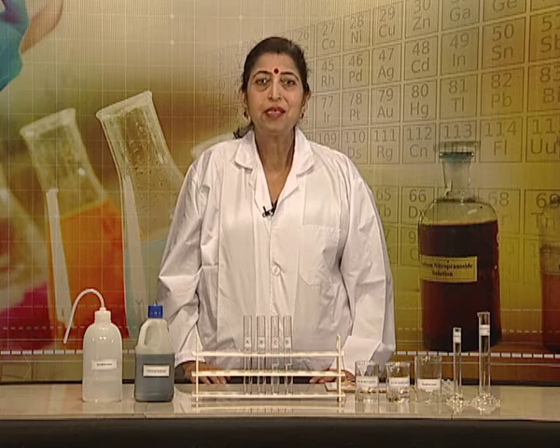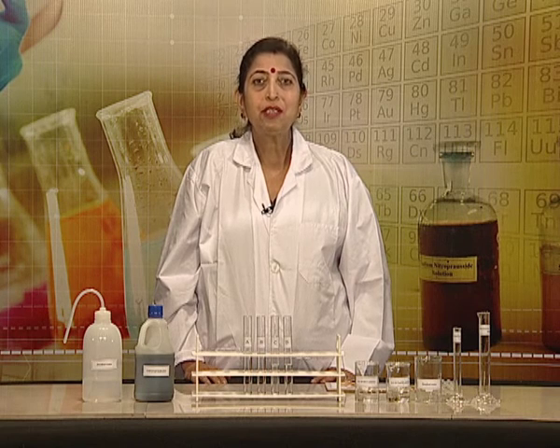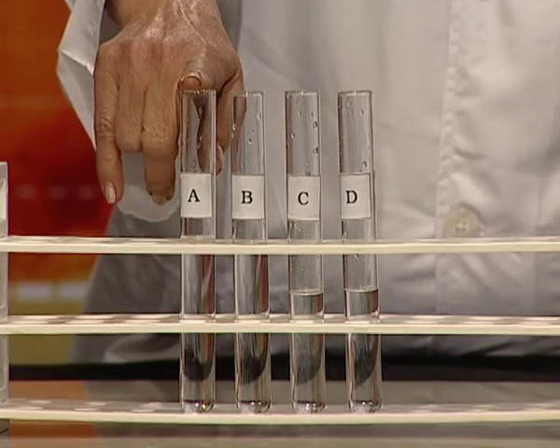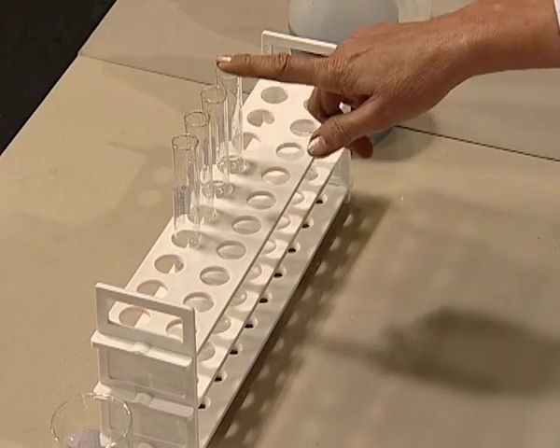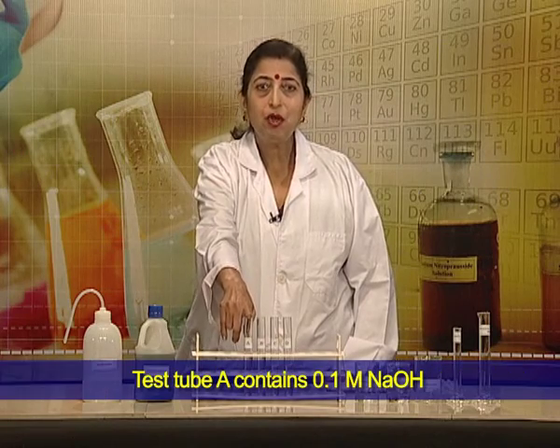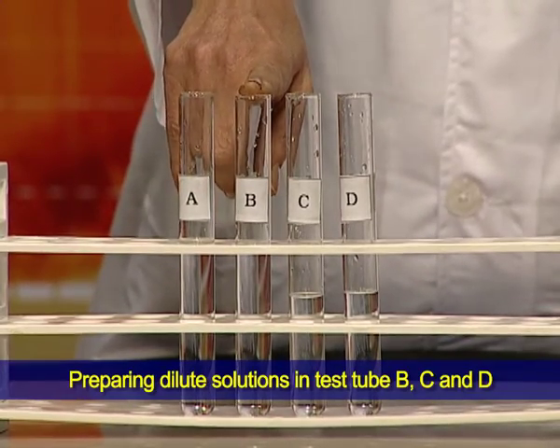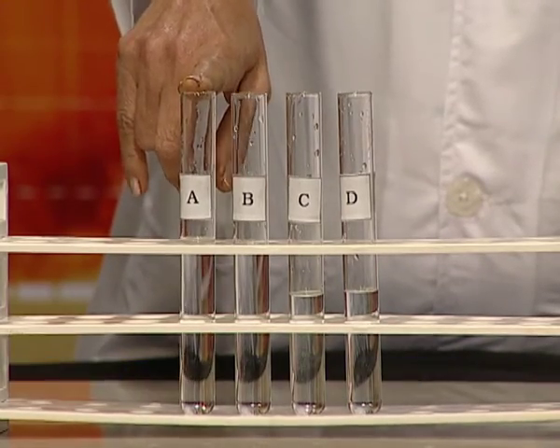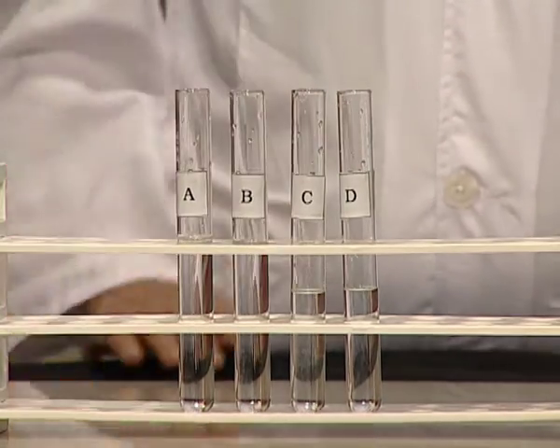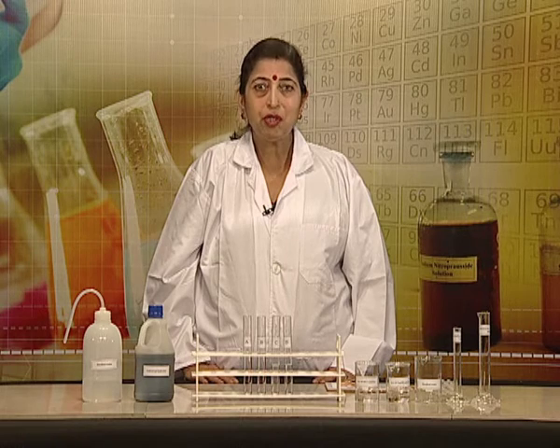Let us start the second part of the experiment. Here we will find out the pH value of sodium hydroxide solutions of different dilutions. We have 4 solutions: A, B, C, and D. Solution A is 0.1 molar sodium hydroxide. Solution B is 100 times diluted from solution A. Similarly, C and D are diluted solutions of solution A. Now one by one, we find out the pH value of all 4 sodium hydroxide solutions.